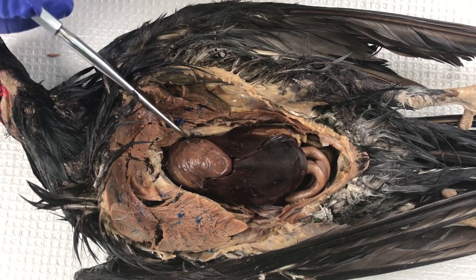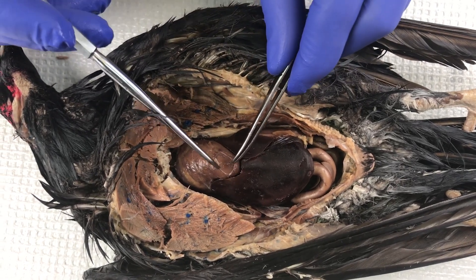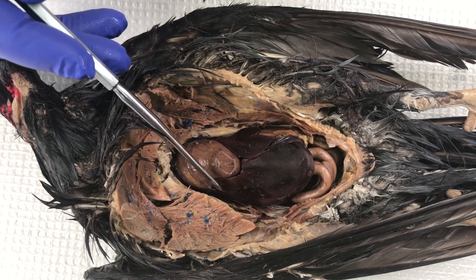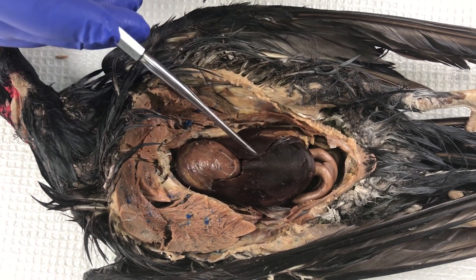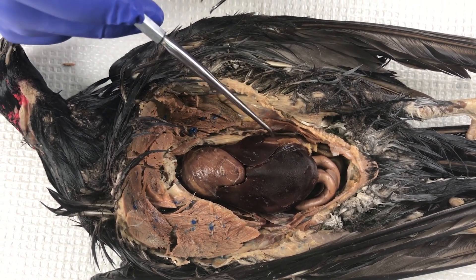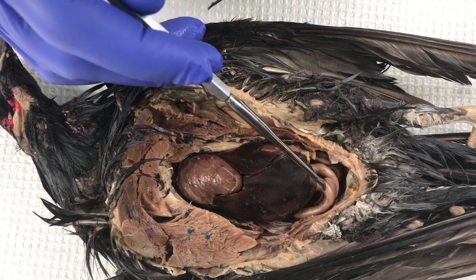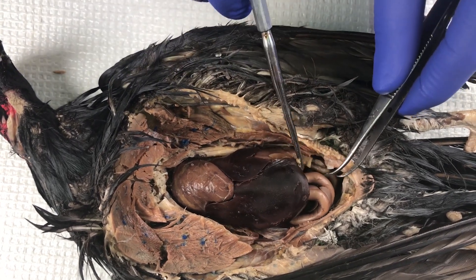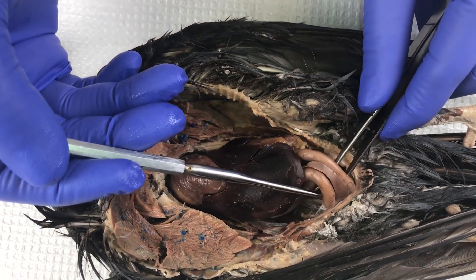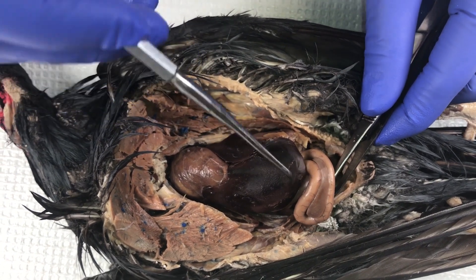If we look at another view, we have the heart — the pericardium isn't as visible here. There are the lobes of the liver, and down to the side you can see the gizzard. In this specimen, the pancreas is clearly visible in the small intestines.